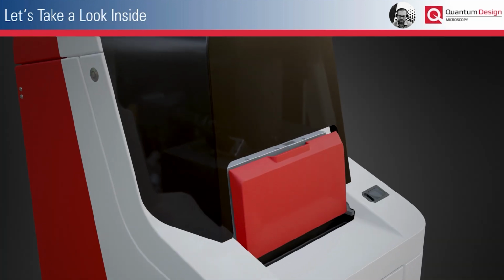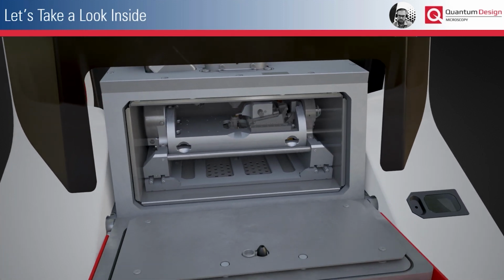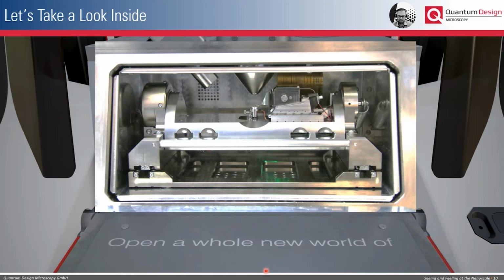So now let's take a look inside the FusionScope chamber. In this animation, you see when we are opening the vacuum chamber, which is behind this red door, that we have this very compact vacuum chamber where all of the important parts are integrated. And in real life, it looks like this, which you see here in this image. And we have a few important parts inside the FusionScope chamber that I want to highlight.